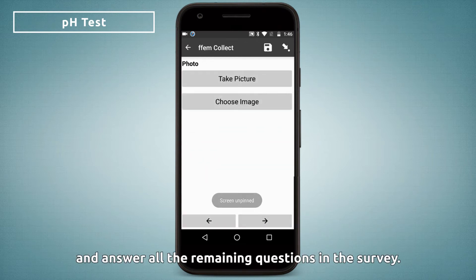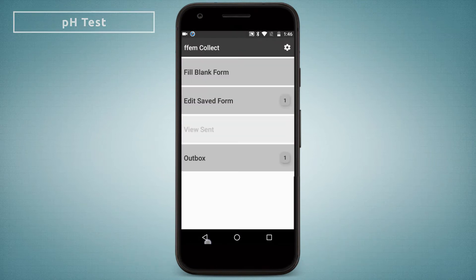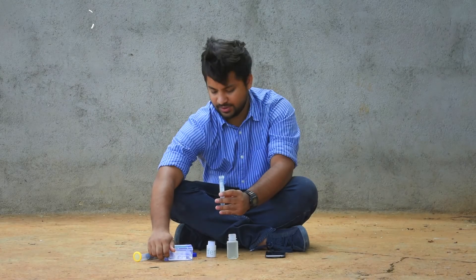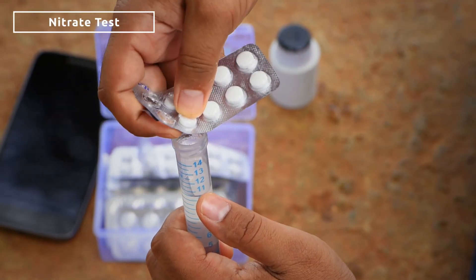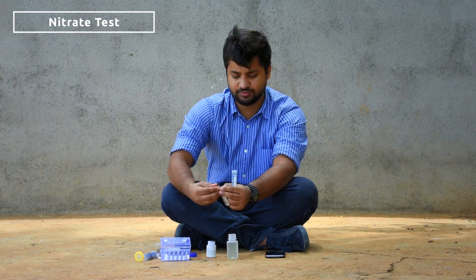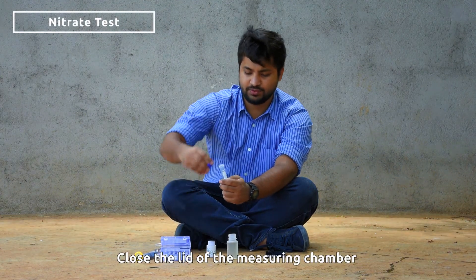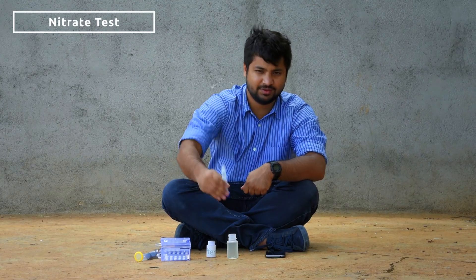Answer all the remaining questions in the survey. Once you are done, submit the survey to the online database. For the nitrate test, add one tablet of nitrate reagent A and one tablet of nitrate reagent B to the sample. Close the lid of the measuring chamber and shake the solution until the two tablets have dissolved completely. This could take up to 2 minutes.